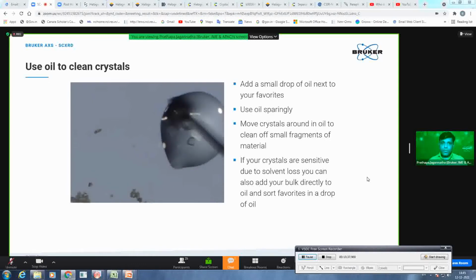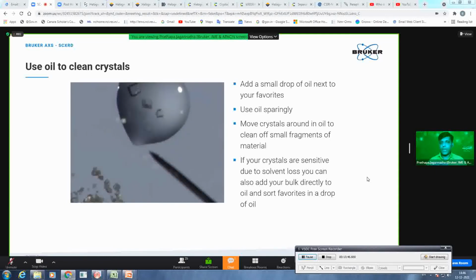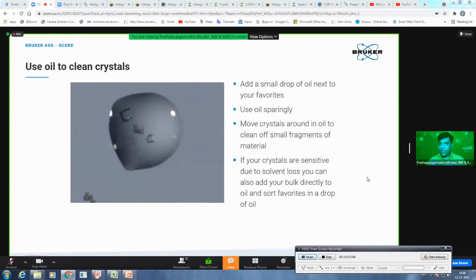Another advantage of doing this is that he is making the crystal smooth if he wants to cut it. For example, just imagine if you are cutting a dry crystal, sometimes it might spill off from your glass slide while you are applying some pressure. If the crystal is smooth and it is in oil, you can cut the crystal very smoothly, and even if it shatters, it stays within the oil and will not fall off your glass slide. 90% of the time that doesn't happen, so it will allow you to cut your crystal smoothly.